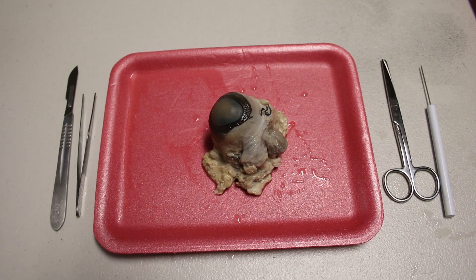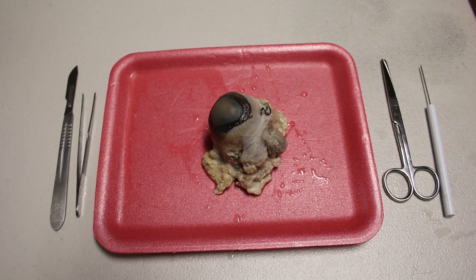Hello everyone and welcome to Biology on Demand's first video. My name is Jacob and today I will be taking you through a step-by-step guide on how to dissect a cow eye. I'm using Carolina Biological Supplies Perfect Solution Cow Eye and their dissection guide. I will leave a link to this in the video description.